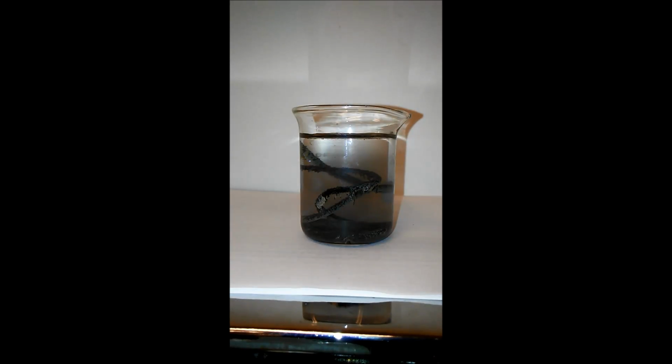So that's that one. Next period, we're doing the other combination. So here I did copper and silver, here I did iron and silver. Next period we're doing iron and copper. There's one other combination at least that could be done, but I'm not doing that one right now today.